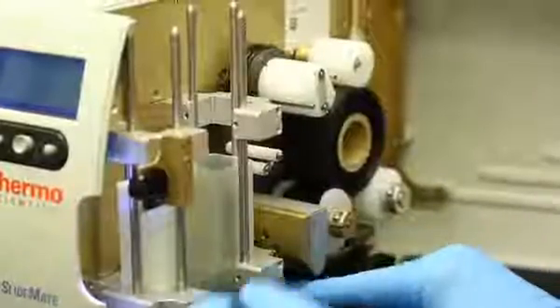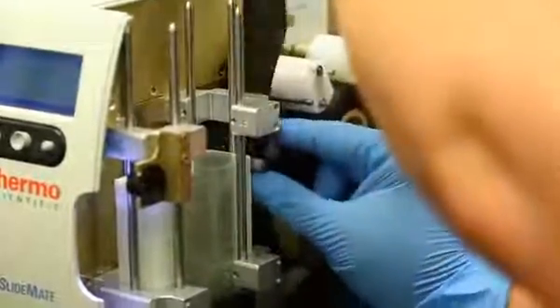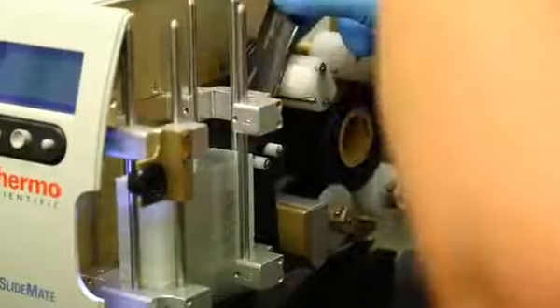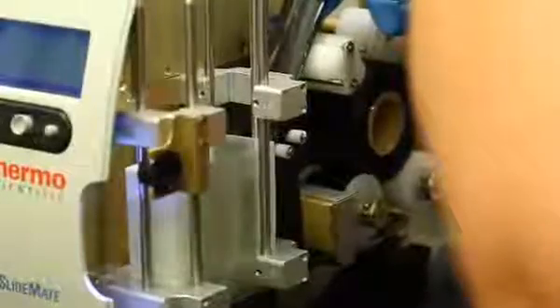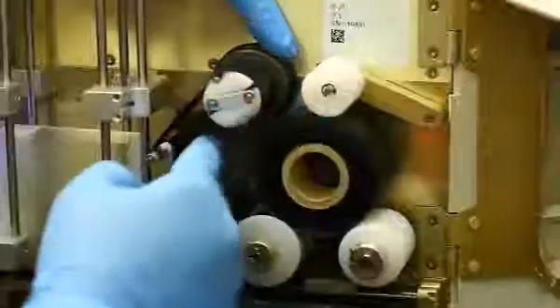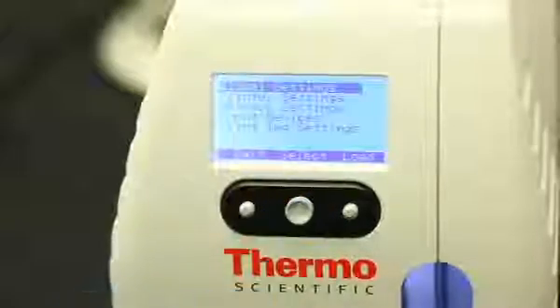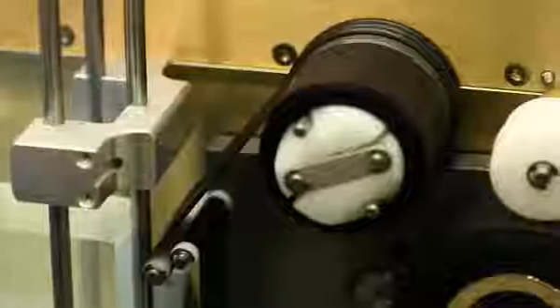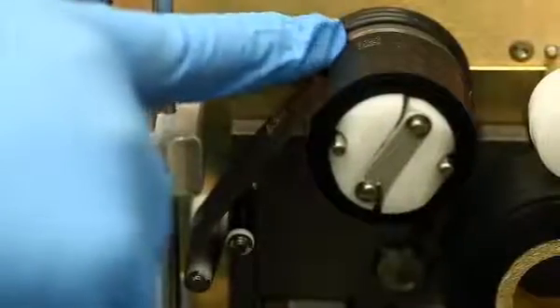The ribbon is threaded over the front ribbon support rollers, under the printhead, up over the first bar of the ribbon take-up guide, then through the middle of the two ribbon take-up guide bars, under the second ribbon take-up guide bar, and up to the ribbon pickup reel. Slide the ribbon under the pin and turn the ribbon pickup reel to tighten the ribbon and remove the slack. Close the door. Press OK, then press Exit. Please note, excess ribbon should be thrown away once the used ribbon is as high as the O-rings.